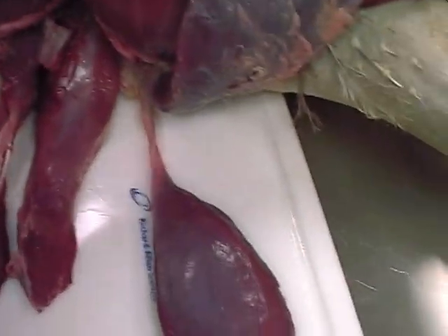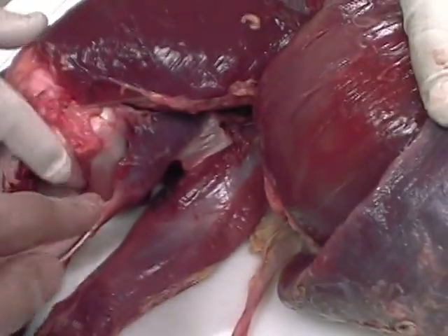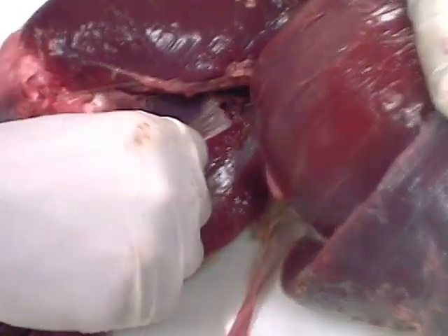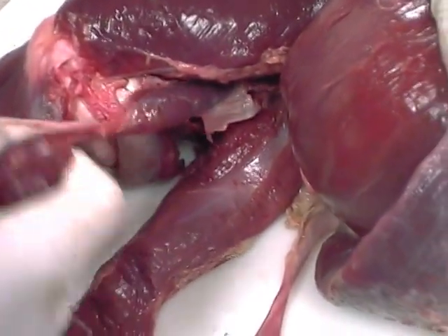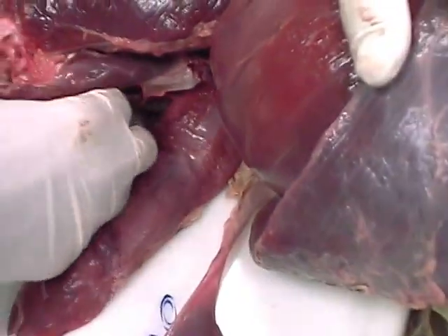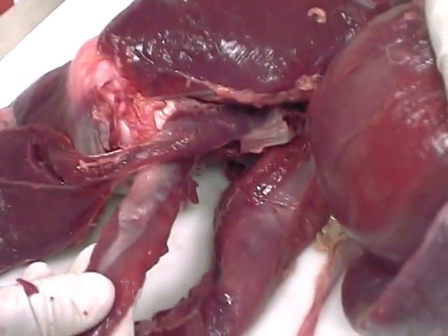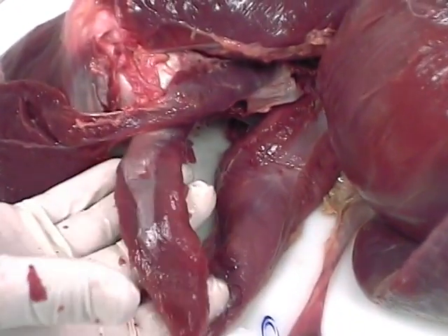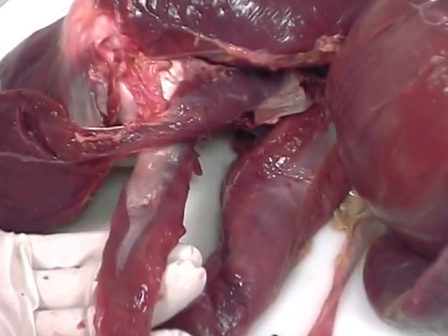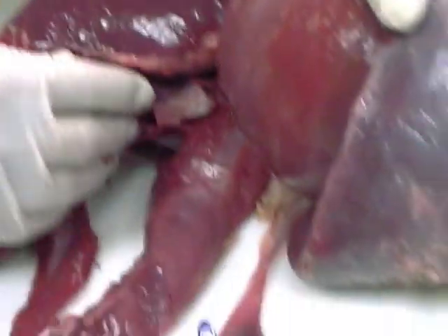And where is — so there's an ischiofemoralis below that little guy. Yeah, there's ischiofemoralis, or possibly a gemellus muscle — depends on where the insertion goes, we'll have to track that.